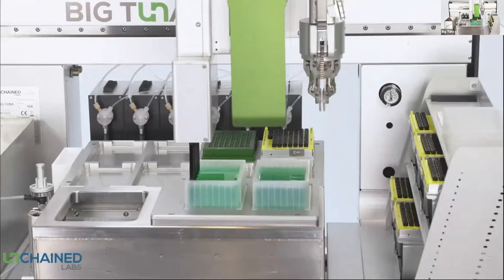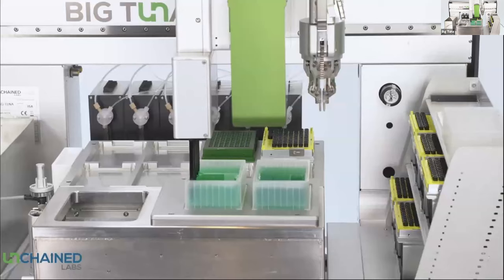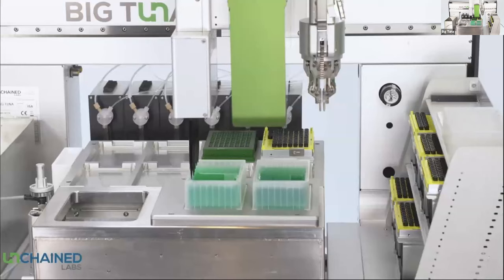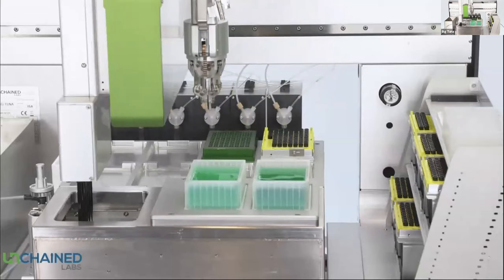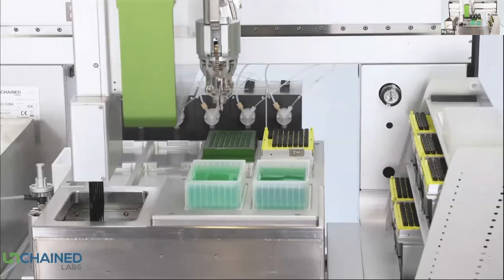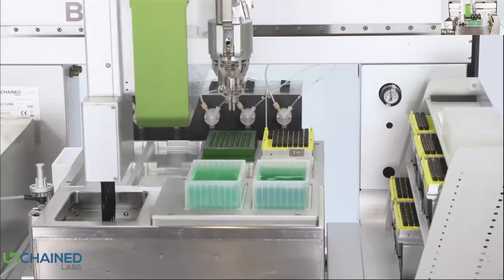We're going to aspirate buffer — in this setup, one buffer going into all 24 wells, although you can do any combination of buffers and proteins. Because we're using the same buffer in every well, we pull up enough volume to access every single well. The system is dispensing the correct replacement volume into each individual well. The tips are above the well height so they never make contact with the sample inside. If we were changing formulations, we would change tips in between to ensure no cross-contamination between proteins or buffers.